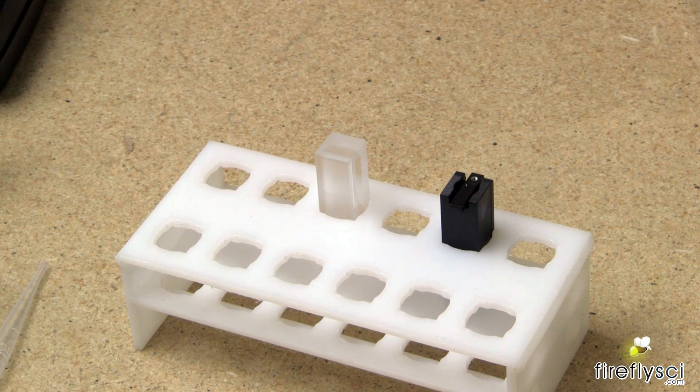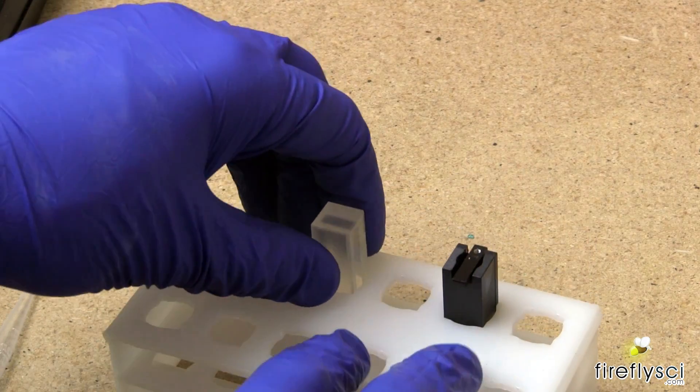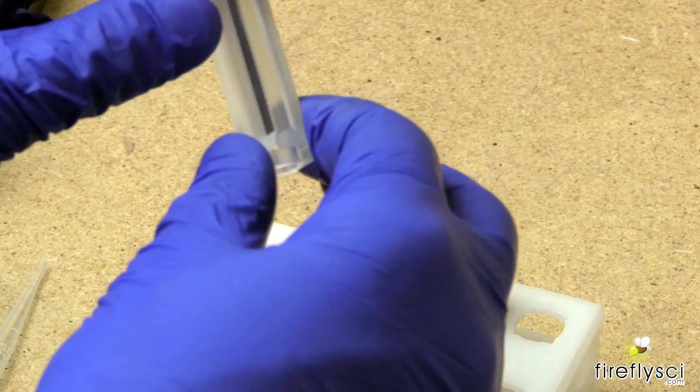So today I'm going to be using our semi-micro cuvette. And the first thing I'm going to do is take a visual inspection of the cuvette to make sure the inside and outside are perfectly clean.